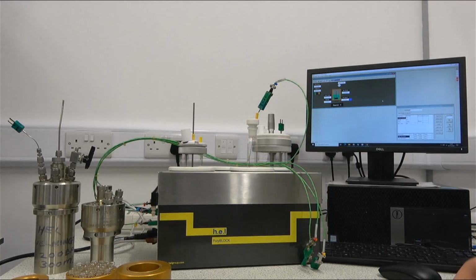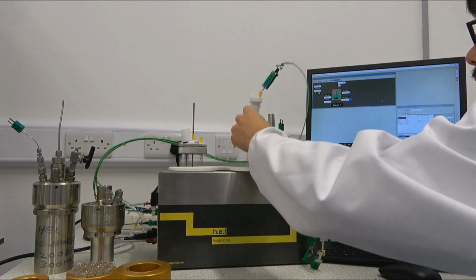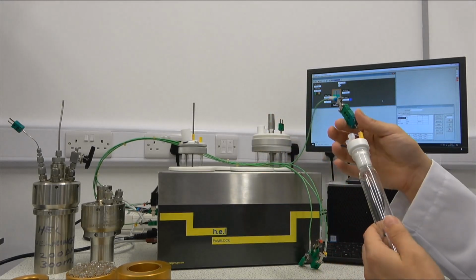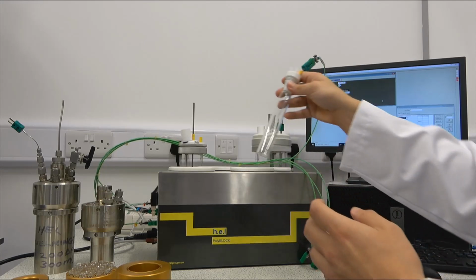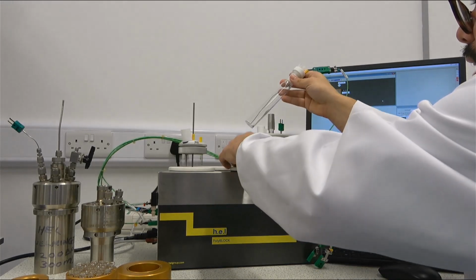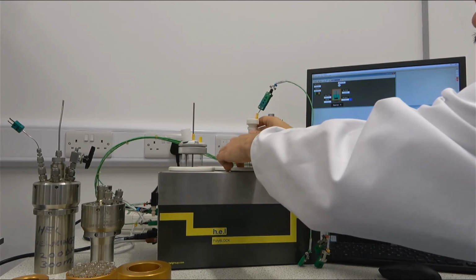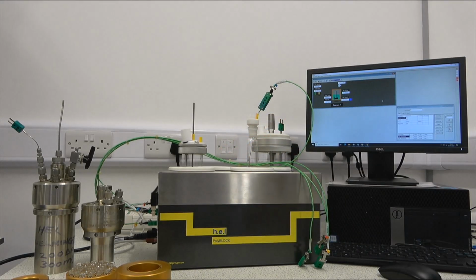We have other sizes as well. We have smaller vials, such as, for example, here is a 20 milliliter vial, and it has a thermal probe. And again, we can provide adapters that very snugly fit our reactors. What is very important to highlight about PolyBLOCK is that we have different options in terms of agitation.